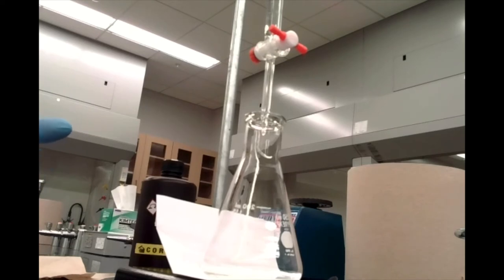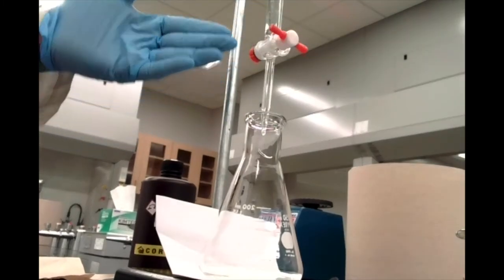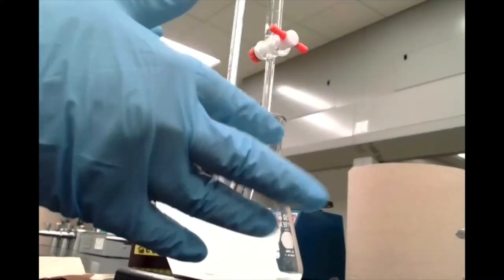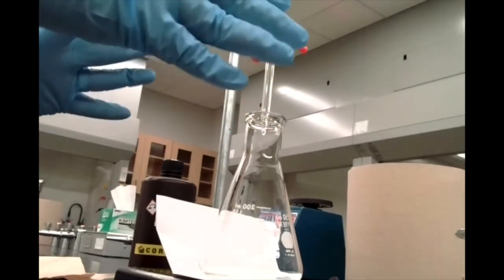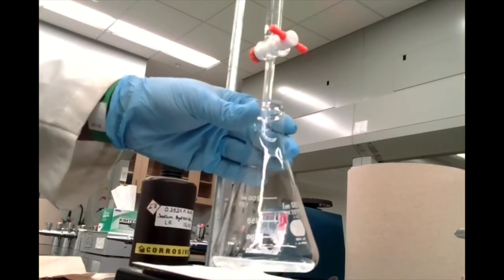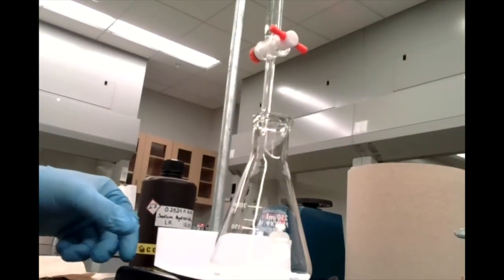Typically the way you handle a titration: if you're right-handed, you use your dominant hand to control the stopcock for better control turning it on and off. You use your less dominant hand — your left hand — to swirl the flask while the experiment's going on. I'll angle the camera so you can see that color against the Erlenmeyer flask.